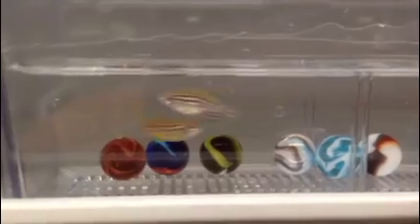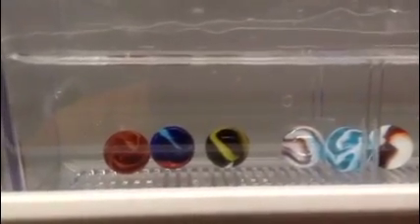We also have a number of mutants in our facility. We have about 10 different mutant lines of zebrafish, some of which we have generated ourselves. And we use all these different zebrafish to generate embryos that we can study.